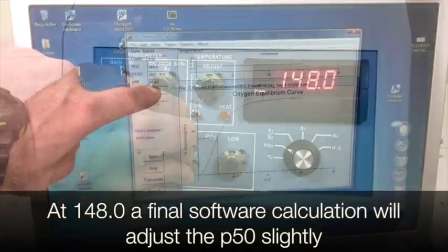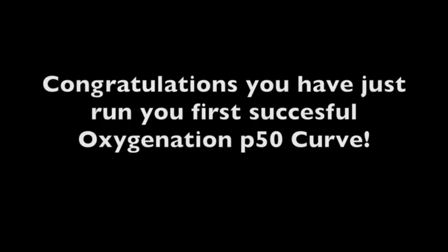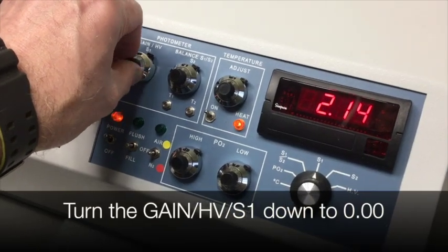At 148.0, a final software calculation will adjust the P50 accordingly. You've just plotted your oxygenation curve. Now you need to rinse out your cuvette. First, turn your gain down to 0.0.